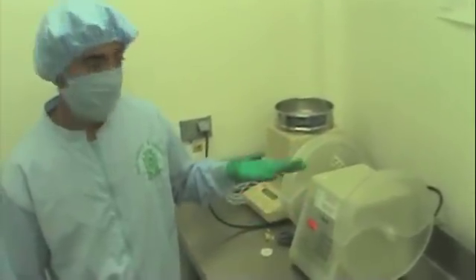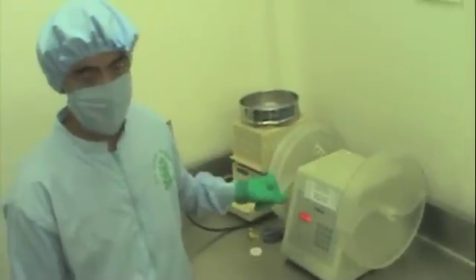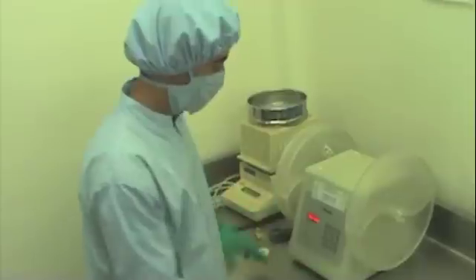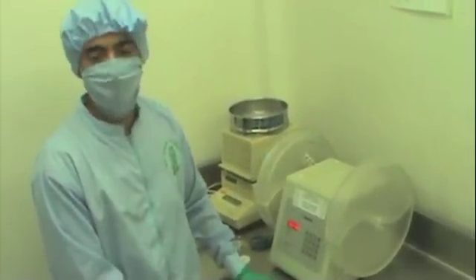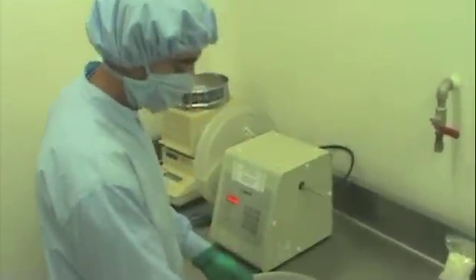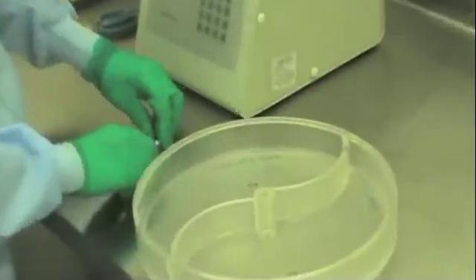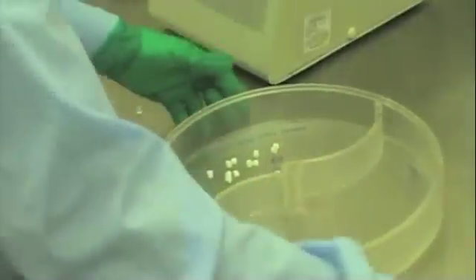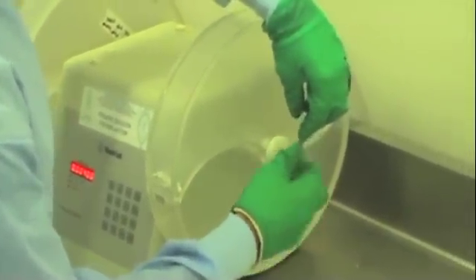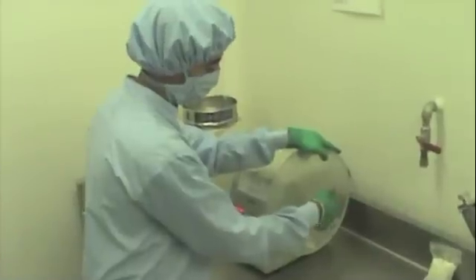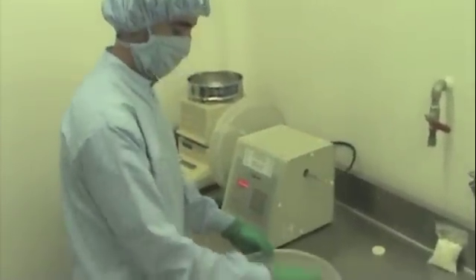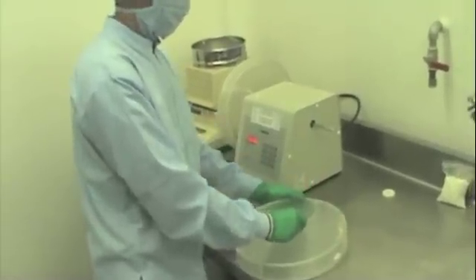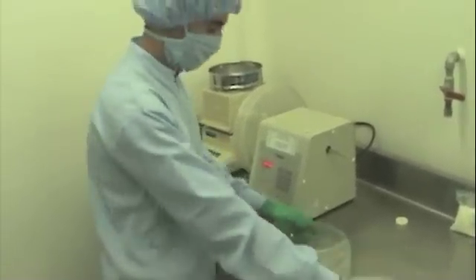That is the Friability Test. In the Friability Test, we are going to use the Friabilator. It is composed of two drums. Here I have 6.5 grams of tablets and I am going to add it into the drum. Once I add it, I pull it back in the machine and I screw it. And the machine will operate for 5 minutes. When the machine finishes, I take out the drum and I have to weigh the tablets and by weighing, I will calculate the percentage of friability.